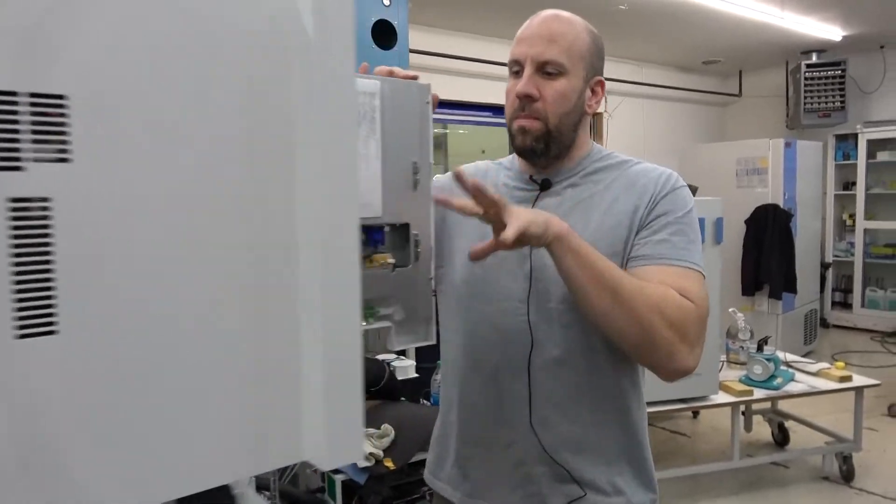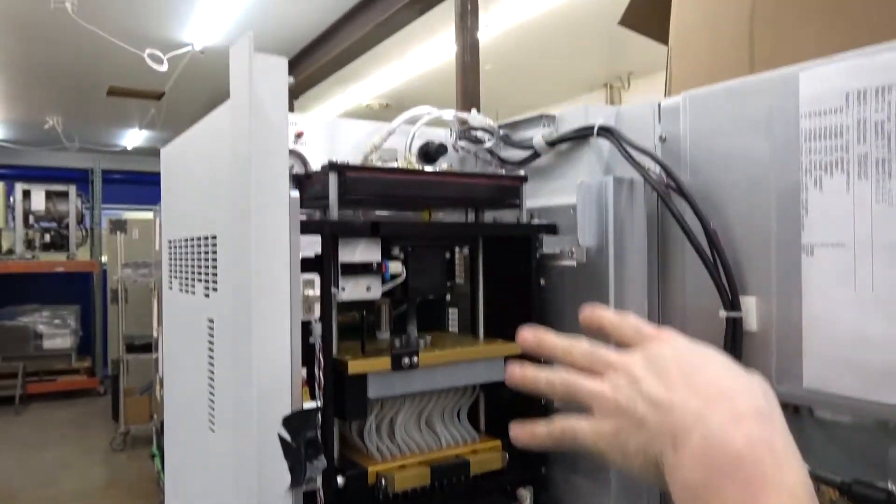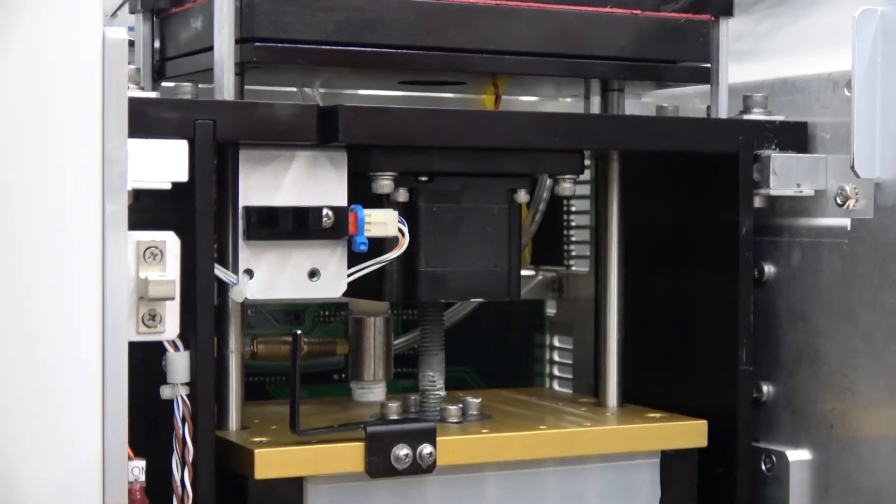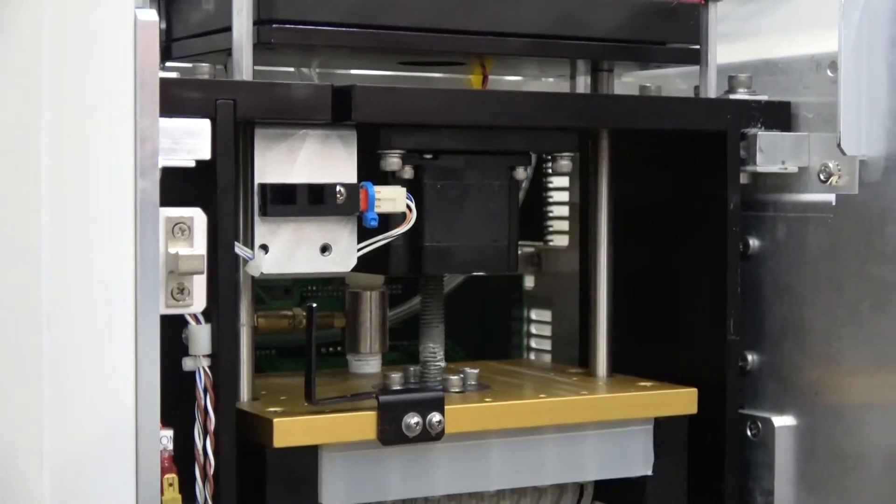Here's your stepper motor and the screw assembly that aspirates the fluid and sends it back out.